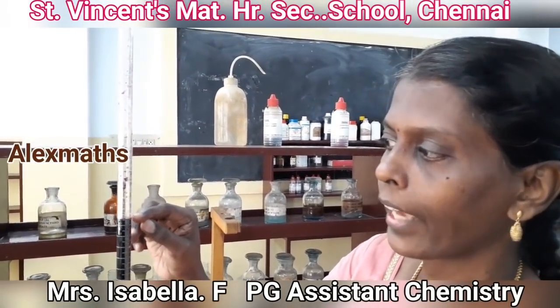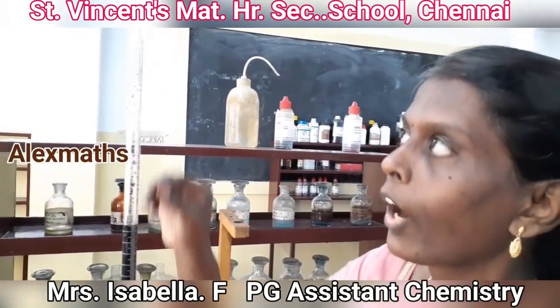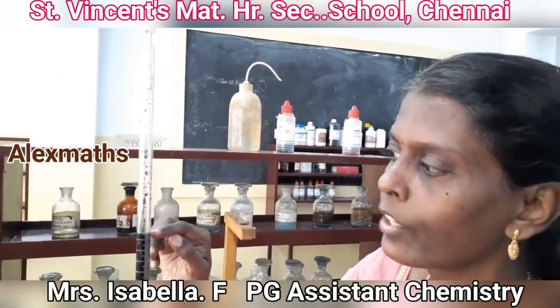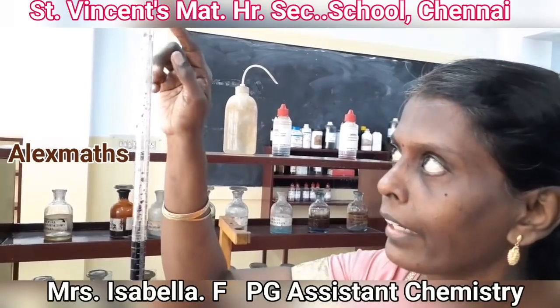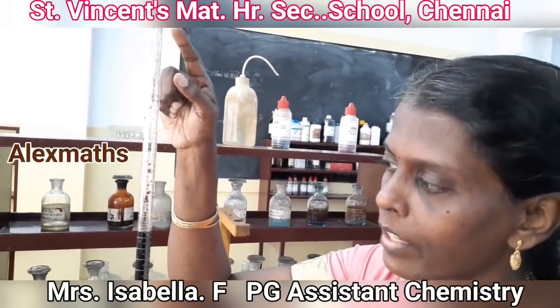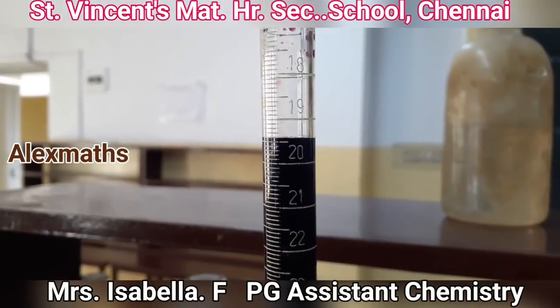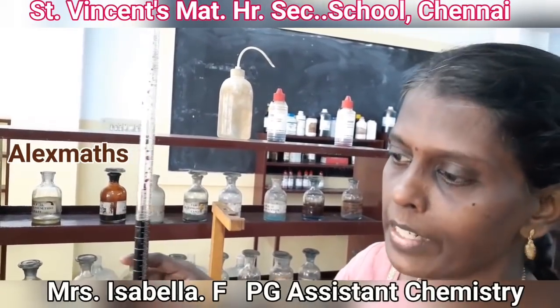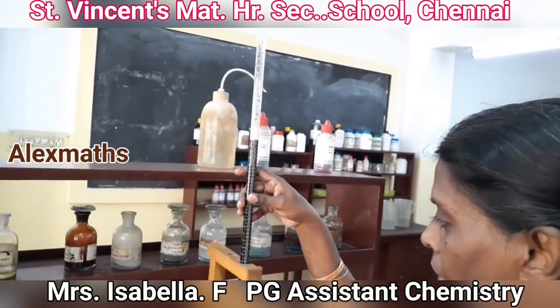is in between 19 and 20. So it is at the 5th division. Now as we are reading the burette from top to bottom, this reading should be read as 19.5. So the burette reading, we read it as 19.5 as the burette is graduated from the top to the bottom. So note down the burette reading, and the burette reading is entered into the tabular column.